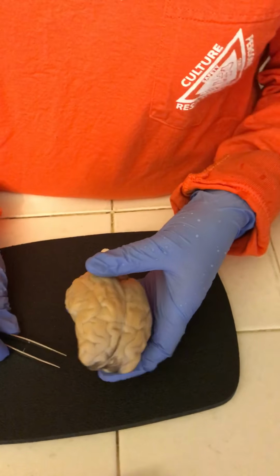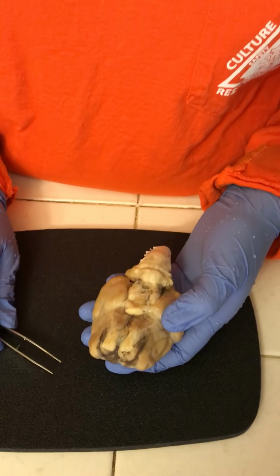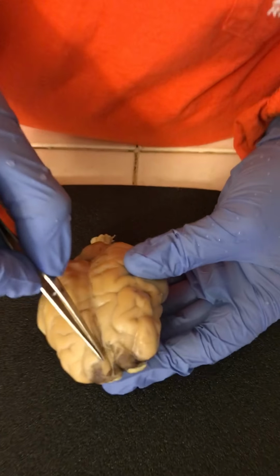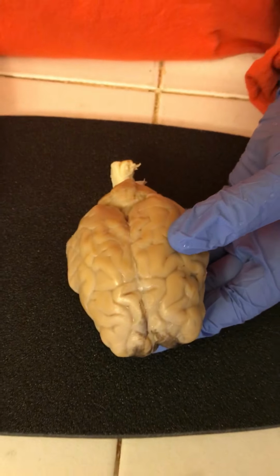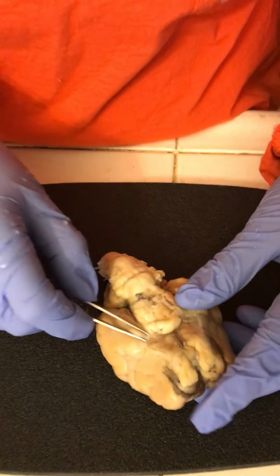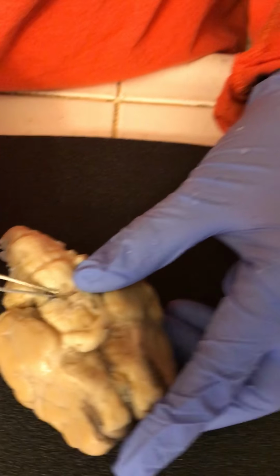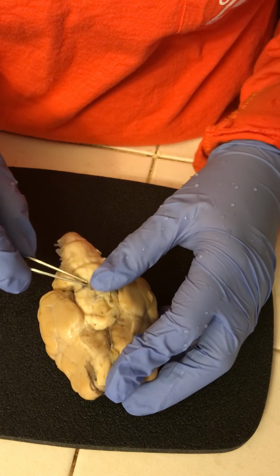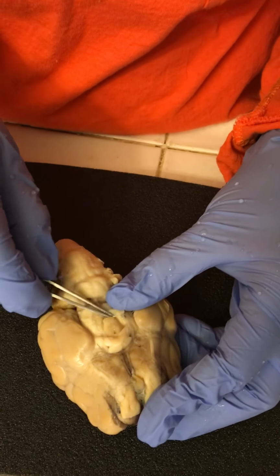And then now I'd like to go ahead and introduce to you guys the longitudinal fissure, which is actually this part right here. So this midline right here is the longitudinal fissure. The mammillary bodies are going to be these two things right here. Actually, no, that's not it. Sorry about that. It's actually more here, right here in the center.